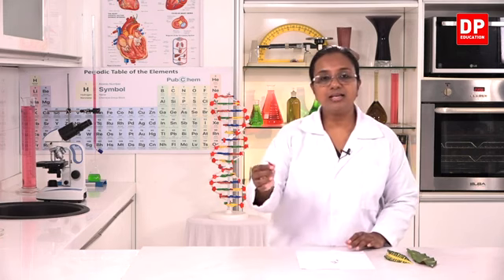So, here you don't have to keep the plant in the dark for 48 hours. Directly I pluck this leaf from the plant. Now, I have to prepare the leaf. You know the steps, students. Boil it in water, boil it in alcohol using a water bath, and then we have to test it for the presence of starch. So, now I am going to do that procedure.